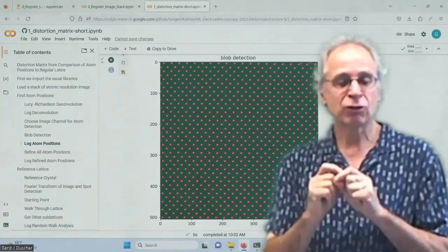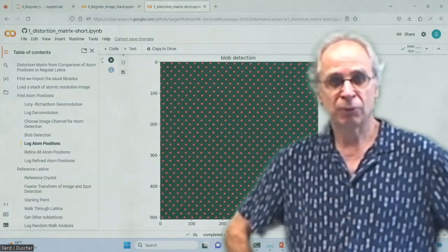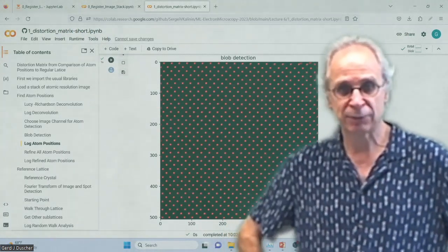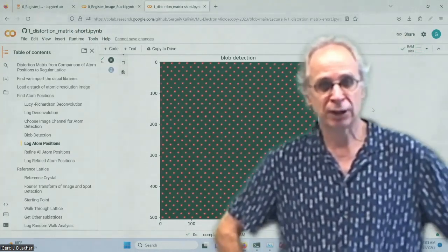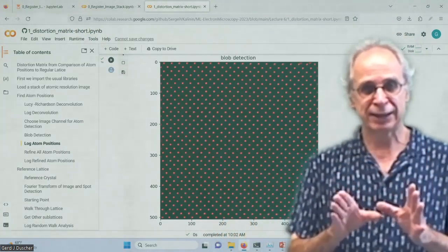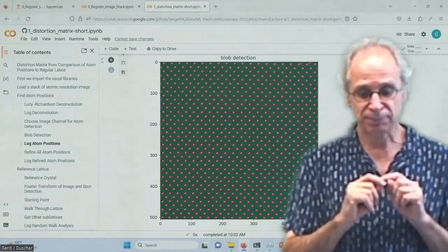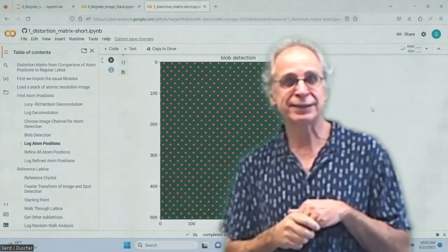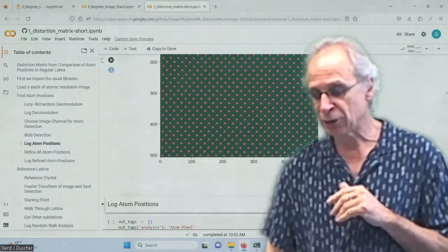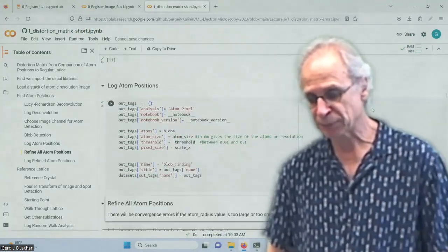So there are good reasons to do atom finding with AtomAI on the microscope, because you want to know when you're on the microscope where the atoms are, and you don't have very good images, it's very noisy and so on. On a good data set, you always will get them, okay? And you will get all of them, or at least the relevant ones, and I'll show you how to get the rest. So we have the atoms, and then we log them.